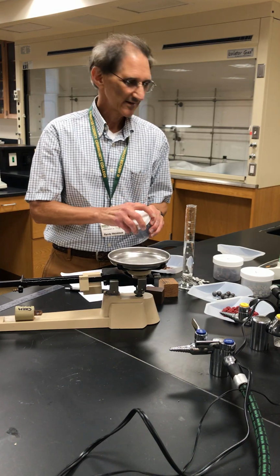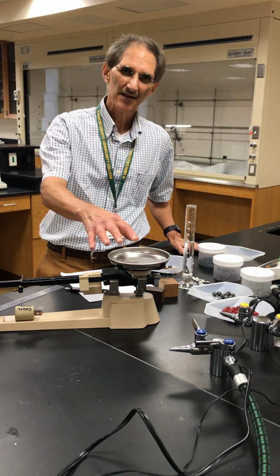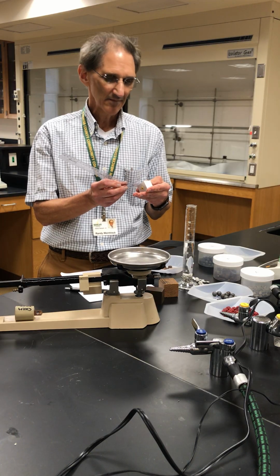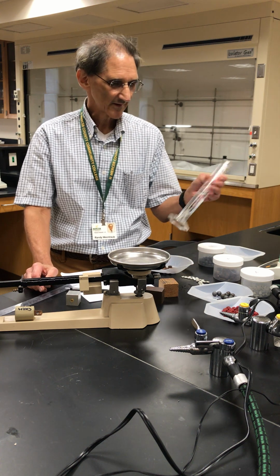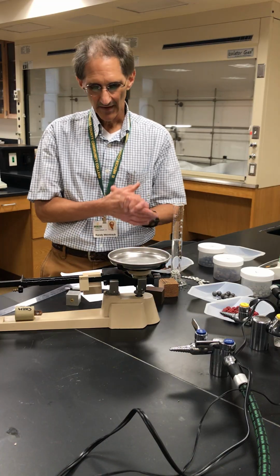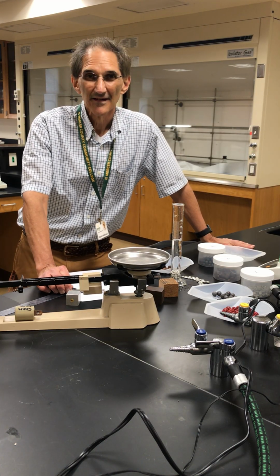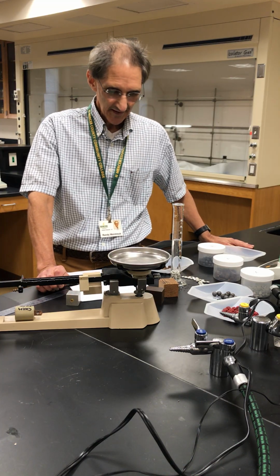These are naturally occurring elements, metals, that we just made mass measurements on this triple beam balance. Some of them, if they're regular, we used a ruler and measured in centimeters, as accurate as possible. And then we also used volume displacement for irregular objects. Okay, so we have enough data to figure out the density of all these materials: aluminum, iron, glass marbles, lead pieces, copper pieces, and wood.